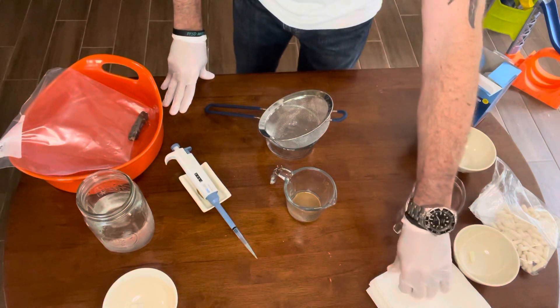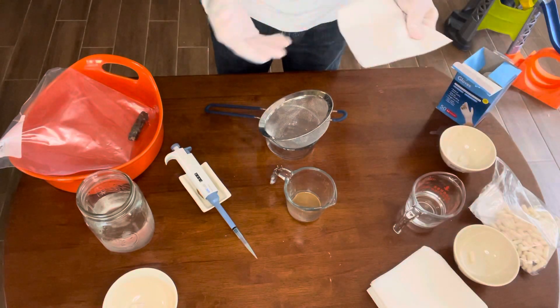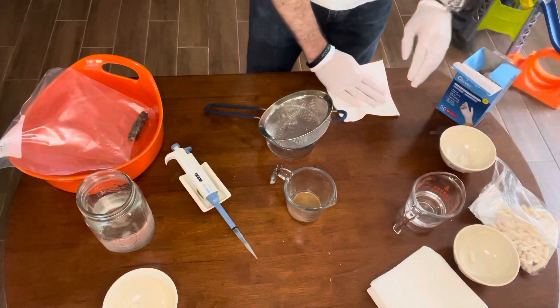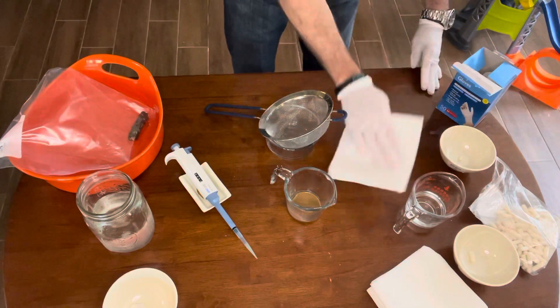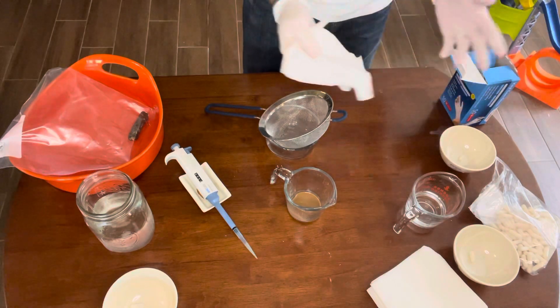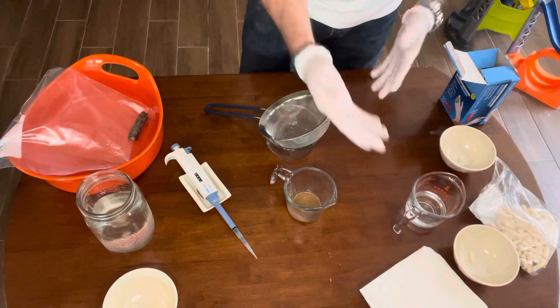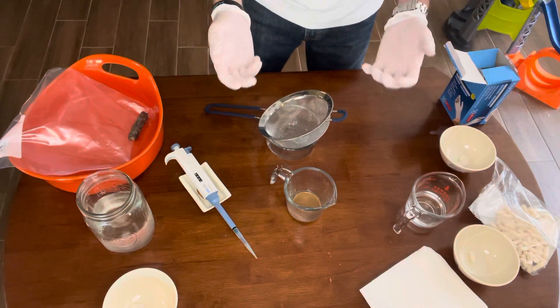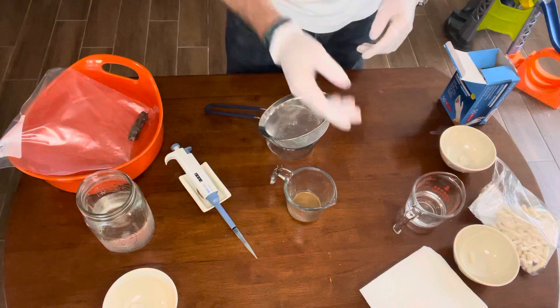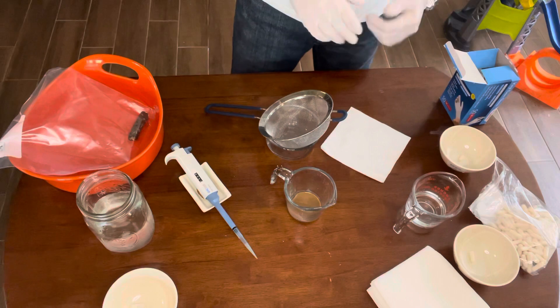After I clean with isopropyl alcohol, I put a liberal amount. The reason I use mostly isopropyl alcohol is because it evaporates and leaves no water trace. I clean unidirectionally — there will be nothing on the table, so I'll wipe in one direction just to push things out, and after three to five wipes I throw the wipe away. You really don't need to wear gloves or PPE, but I find it much easier. If I have a spill I can just remove and throw away. If I have a spill, I don't go cleaning it — I just blot it with some tissue and keep moving on.